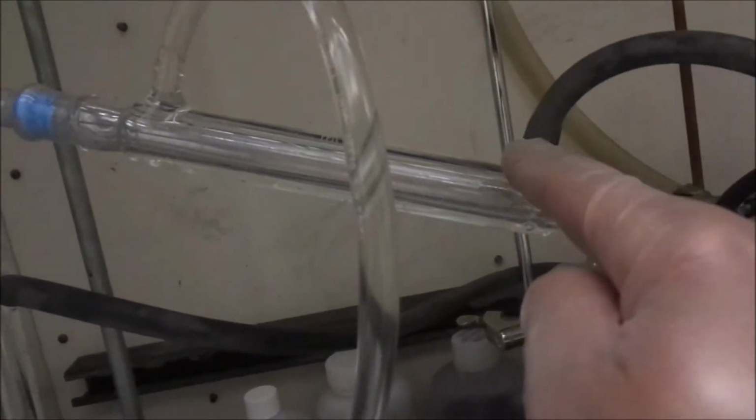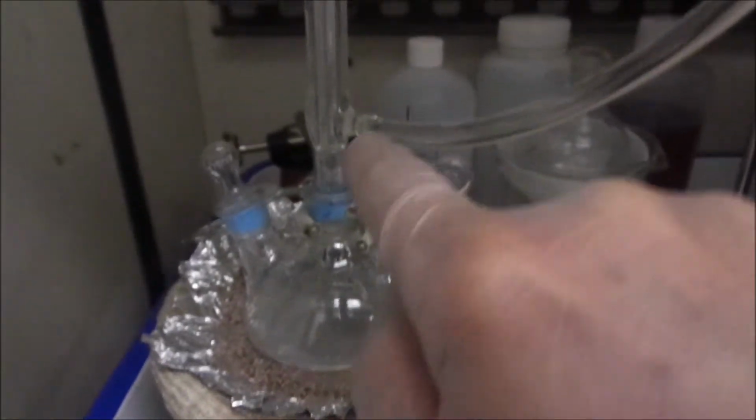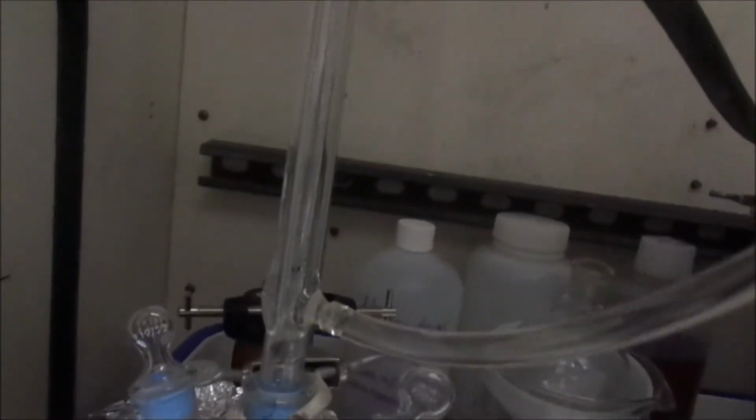I decided to make one more change on this thing. So originally, for the condenser here, I had the water come in, flow through the condenser and then go out to the drain. Instead, I decided I'm actually going to hook this condenser up, because what I noticed is that the mercury was just kind of coming up and it wasn't dropping back out as fast as I would have liked. So I decided to take the slightly warmish water coming off the condenser and flow that through here. It's going to drop out more of the impurities a lot faster. In fact, you can even see it doing it right here at the beginning of the tube. Give it a few minutes, so I'll be here for a while, but you guys will be able to see it in just a few seconds if this actually was a good idea or not.